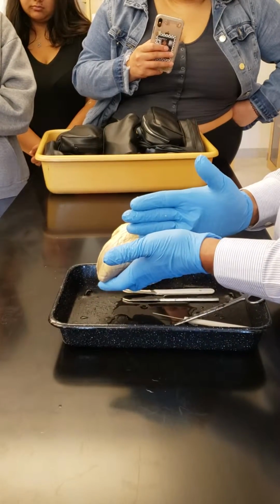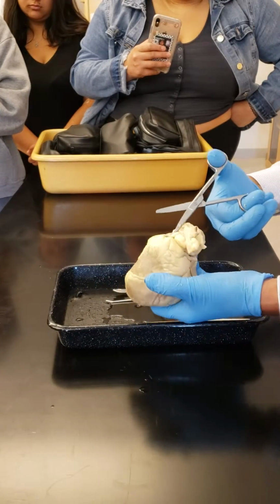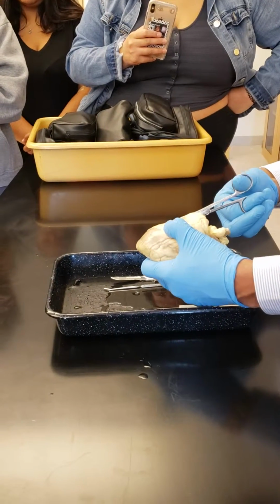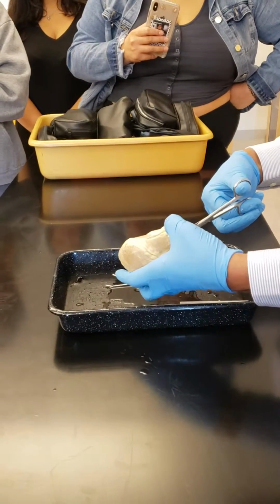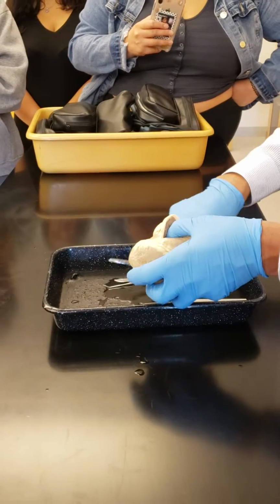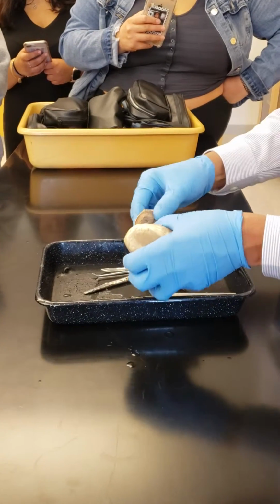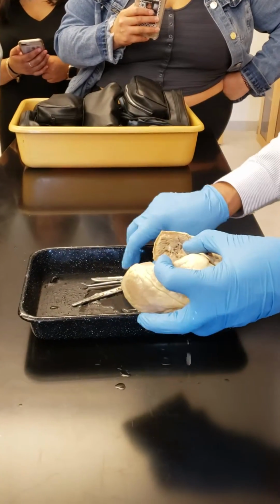So what I'm going to do is look at this chamber. This is the right atrium. I'm going to cut it into the ventricle. And when I do that, I will be cutting the top part of tricuspid valve, correct? So if I open up like this, I will cut it more, going parallel to this. And you see the valve here? This is the valve attached to threads.